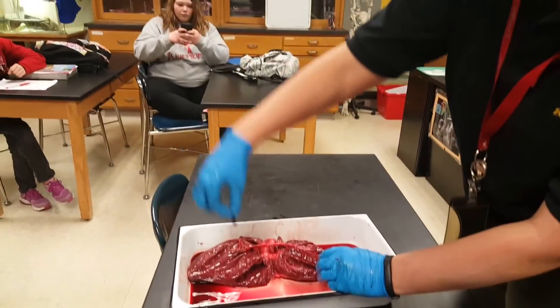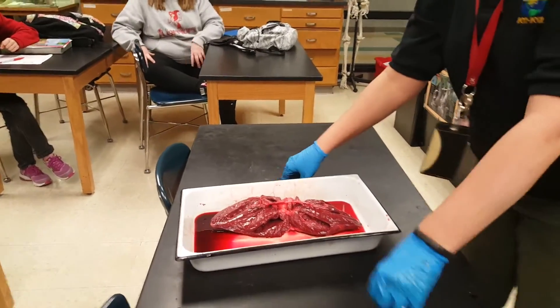What's that? It looks like a blood clot. All right, thank you for the videos. You're welcome.